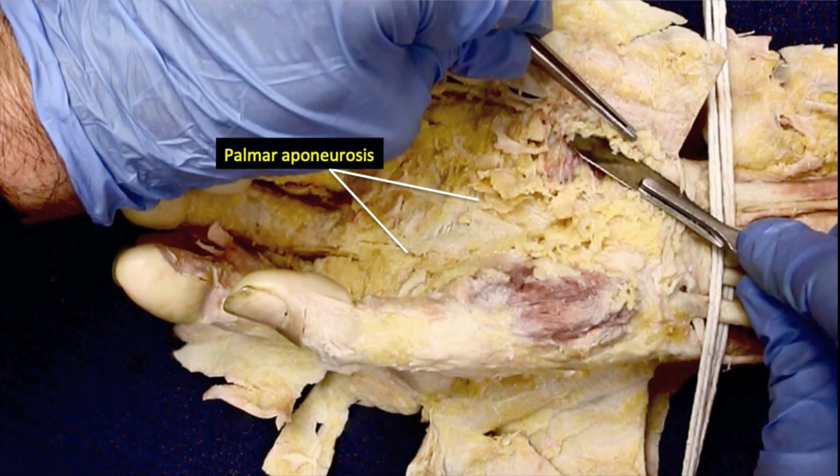The deep fascia of the palm is very thick and tough. This thick fascia is triangular in shape and occupies the central area of the palm and is given the name of palmar aponeurosis. As it spreads to the thumb and little finger, the fascia thins out. The function of the palmar aponeurosis is to protect the underlying structures. Because of the tough superficial fascia and this thick, deep fascia, removal of the skin, superficial and deep fascia of the hand is very time-consuming.